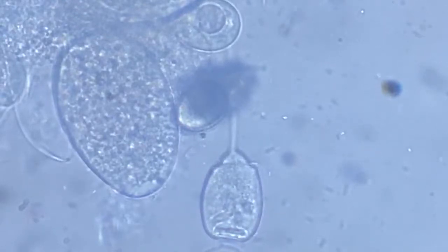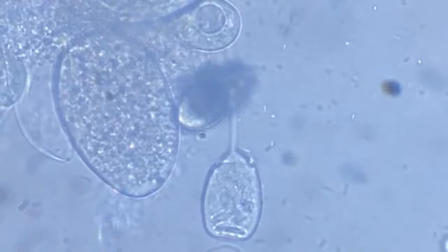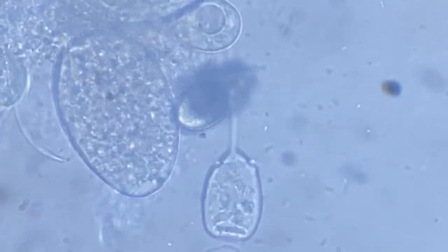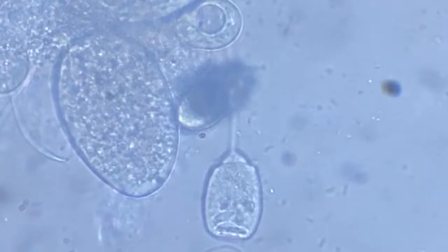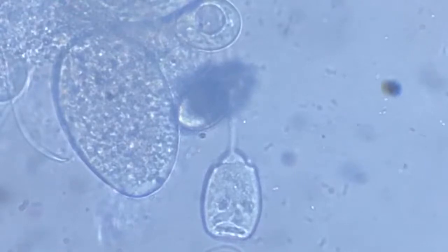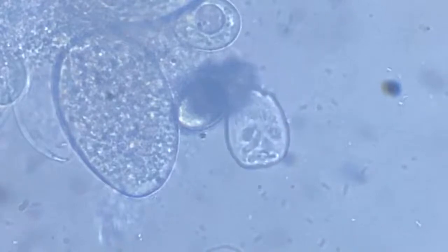It emptied. Did you notice? It was such an interesting sight. Now another vacuole is being formed. I hope you didn't miss that vacuole being emptied out. Another vacuole is forming now, slowly increasing in size. Meanwhile, did you see? That was so interesting.